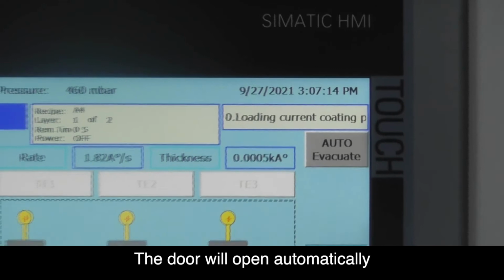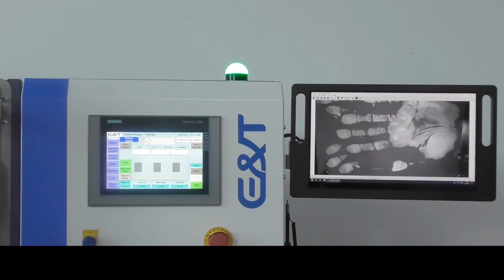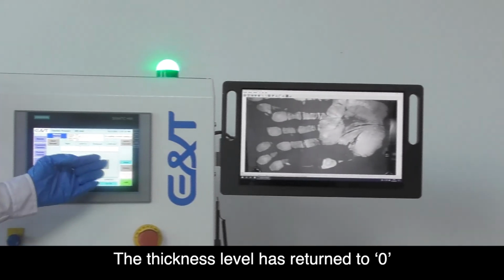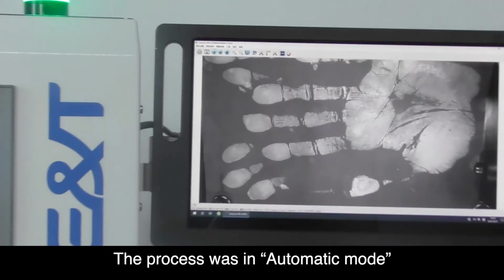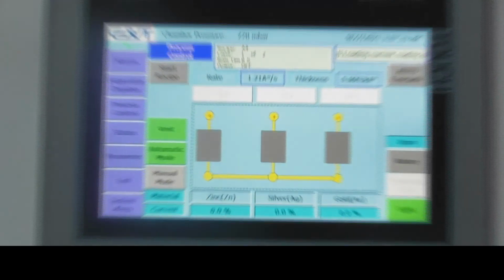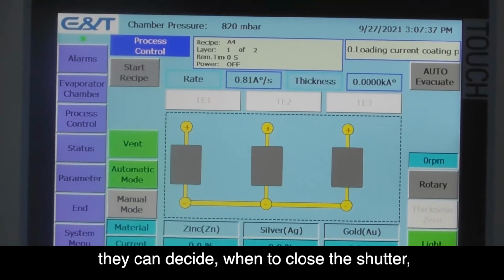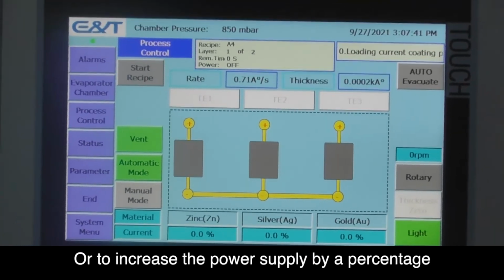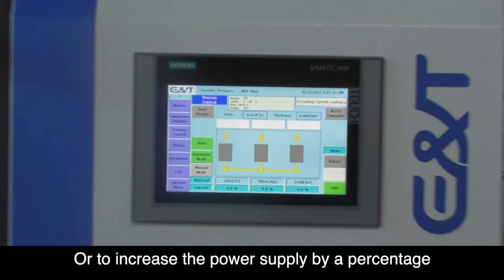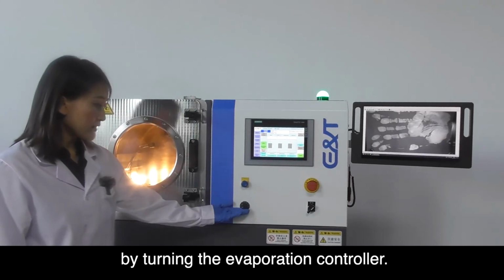Click Vent. The door will open automatically when the pressure reaches the optimum level. The thickness level has returned to 0. The process was in automatic mode. If the user chooses manual mode, they can decide when to close the shutter by using the shutter controller, or to increase the power supply by a percentage by turning the evaporation controller.